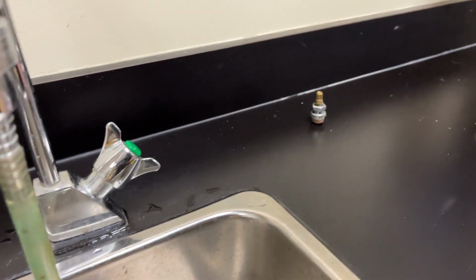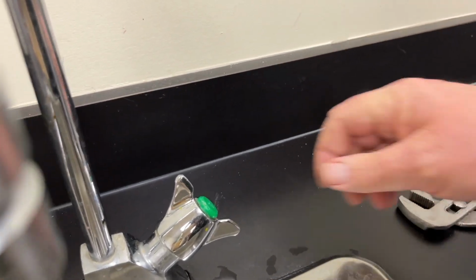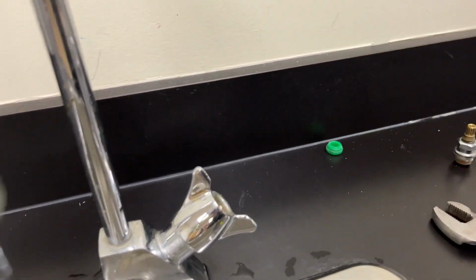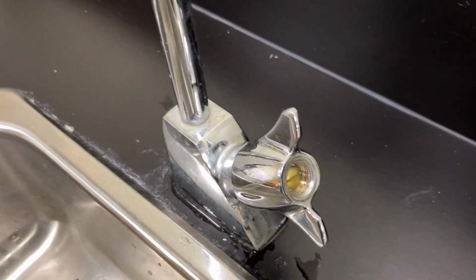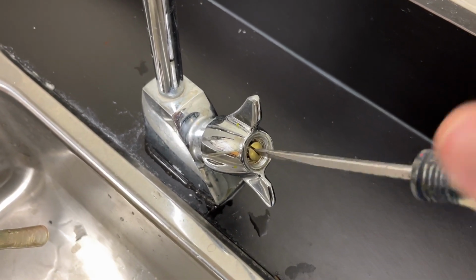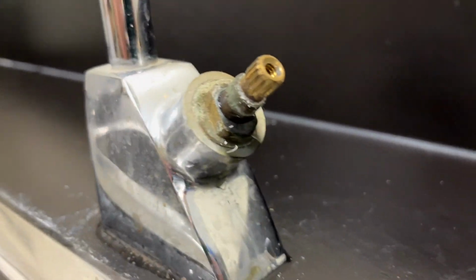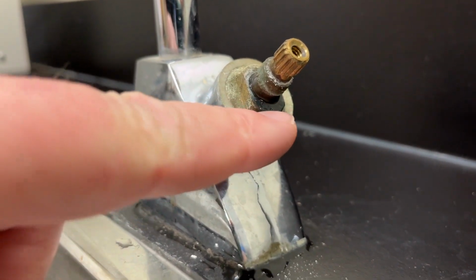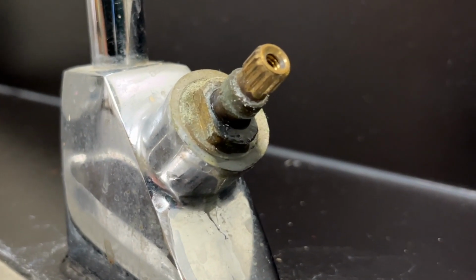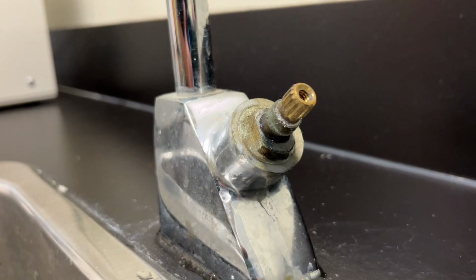Now, I open that up all the way because I need to turn this in the same direction. To the left, to the left, to the left. Here, which will allow me to get in here. So, yeah, there's our leak right there. Except that now that I have the handle off, I can see that it's not coming through the threads, but through the stem of the faucet cartridge. So let's take this bad boy out and see what's going on.